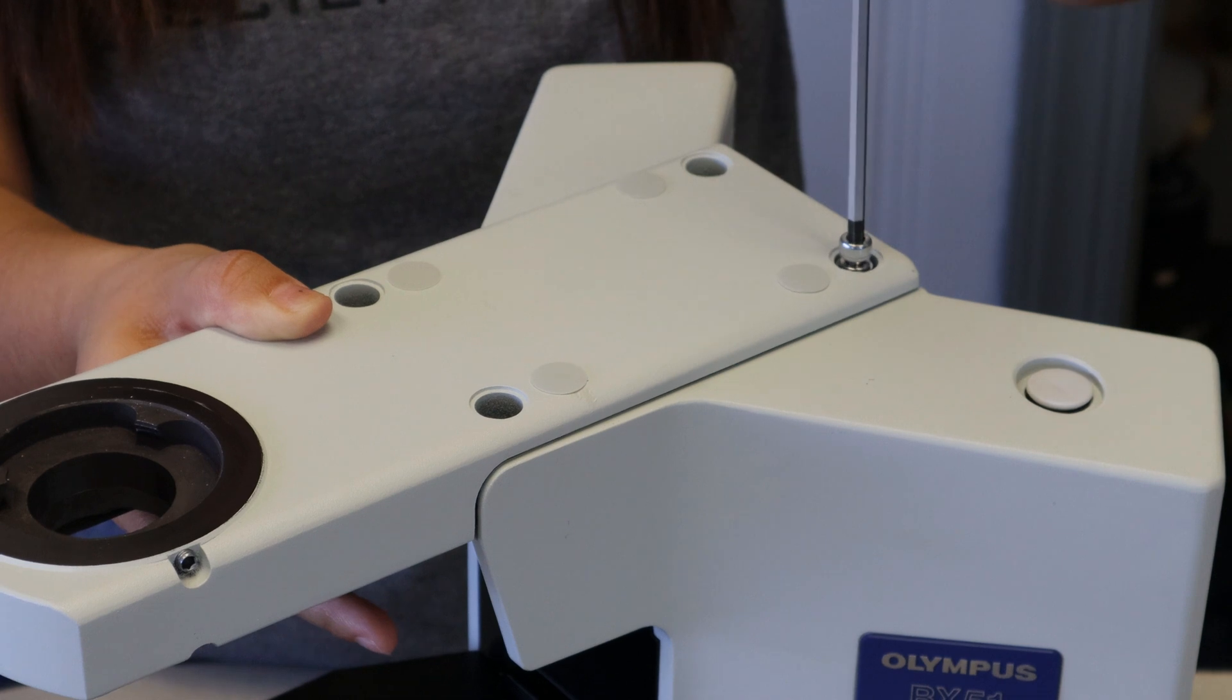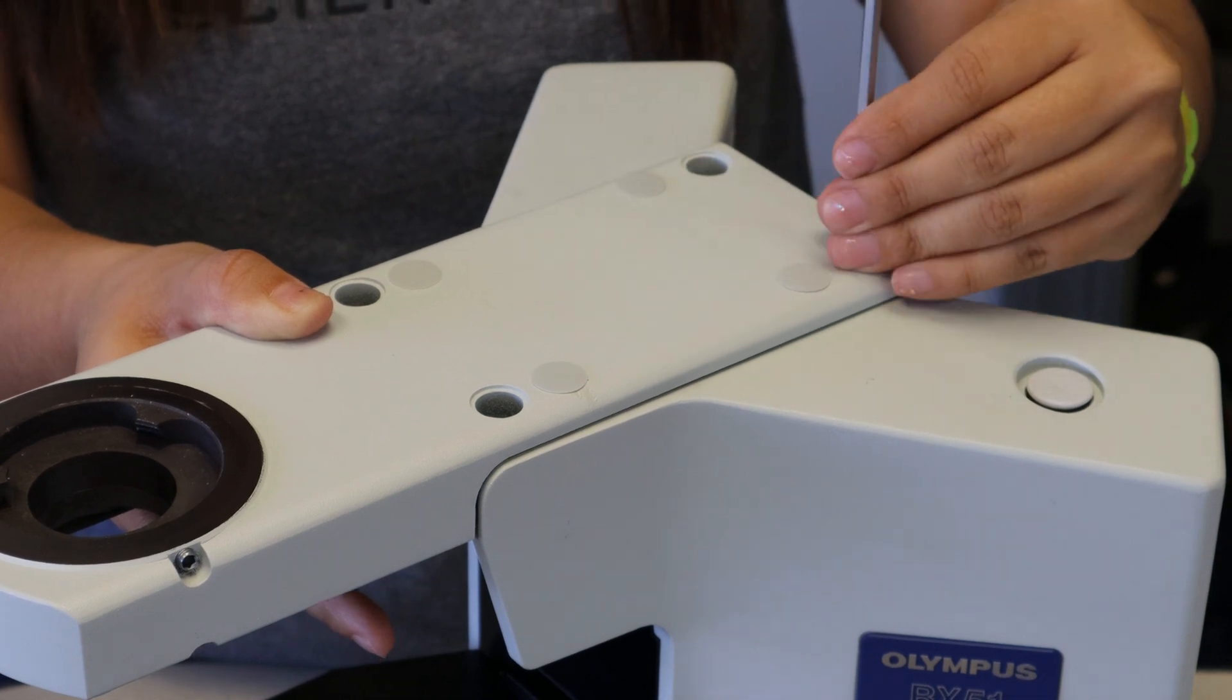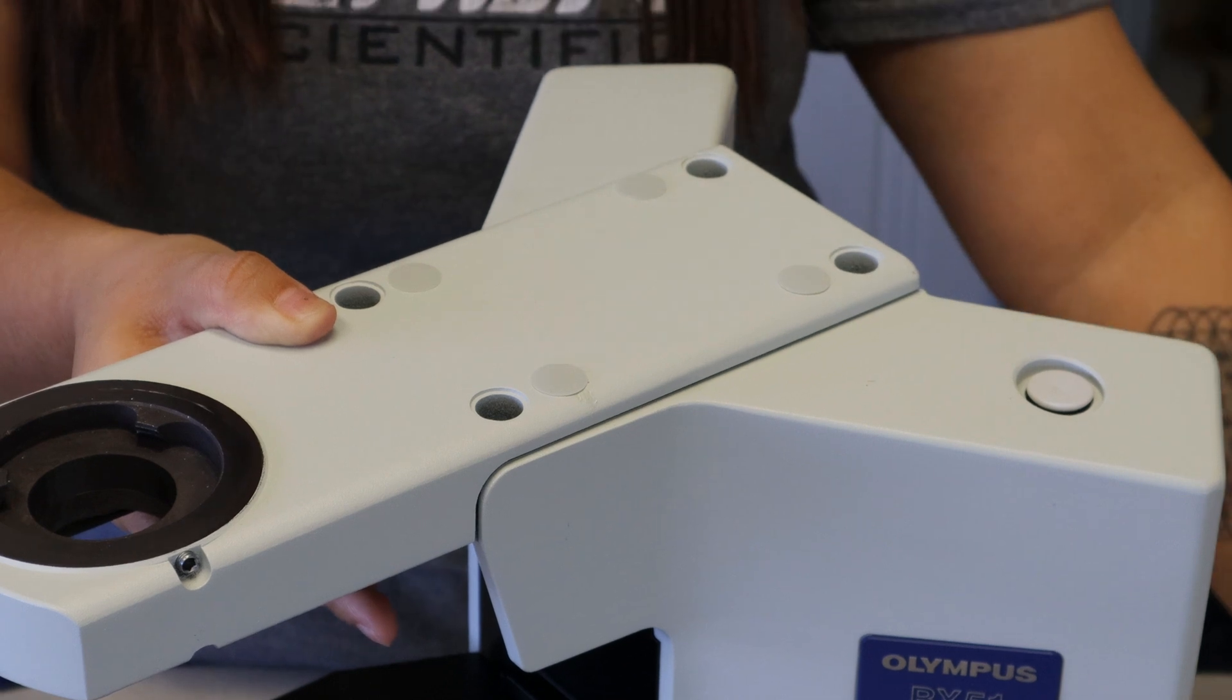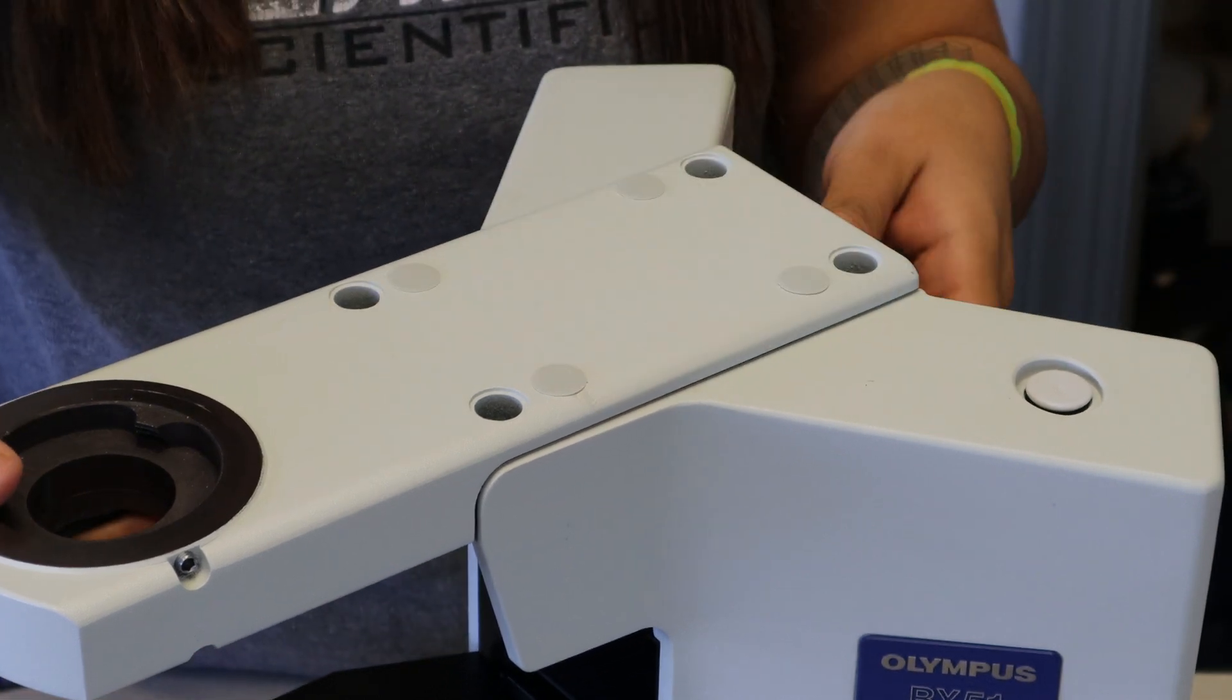Okay, as you can see, I'm doing that last bolt, and once it's out of the way and you've got your hand underneath the end of the original top plate, just go ahead and lift it out of the way and set it off to the side.